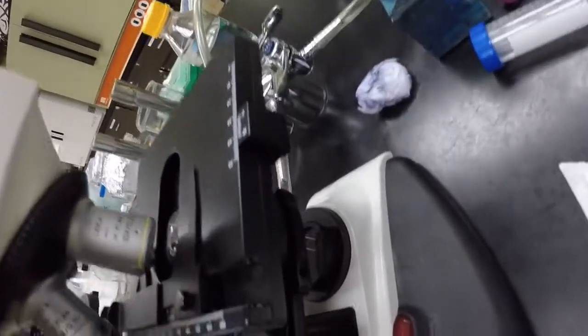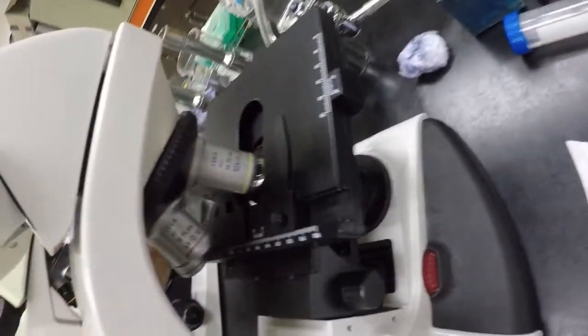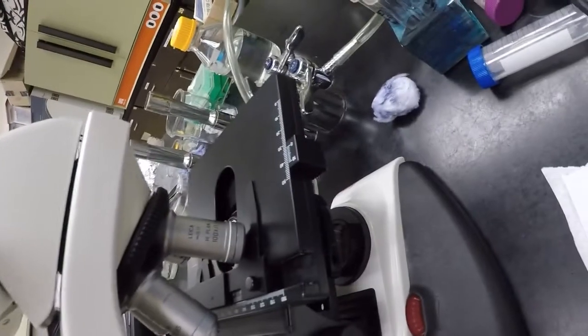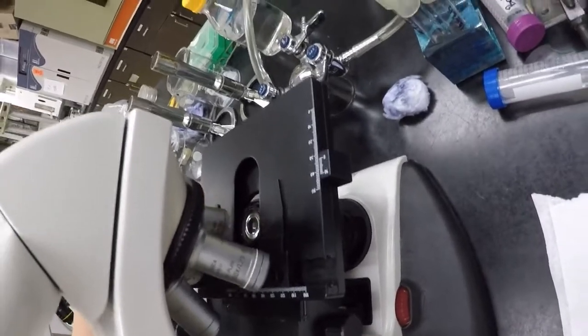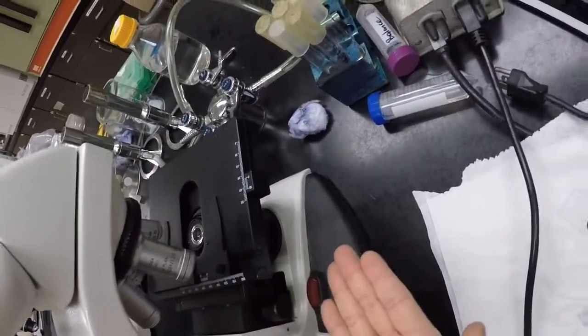All right. I don't know if you guys can see that. There we go. We have lens touching stage. That's a $1,000 lens. Here's 100 times. Lens touching stage. This one is like an $1,100 lens, right? So avoid this kind of stuff, right? So in general, first thing you do before you do anything, stage all the way down, 4 times lens in, safe position, right? This keeps our microscope nice and safe.